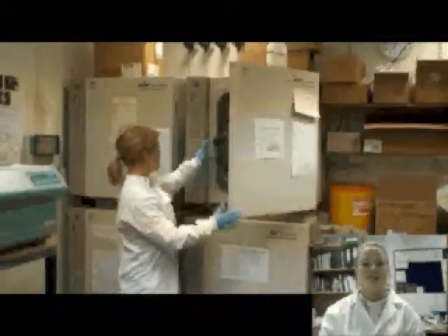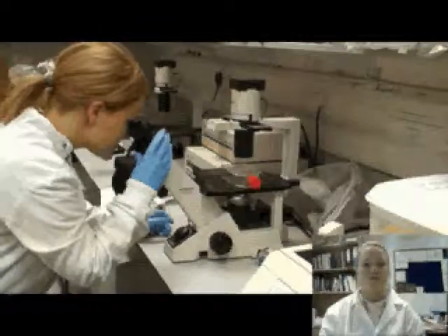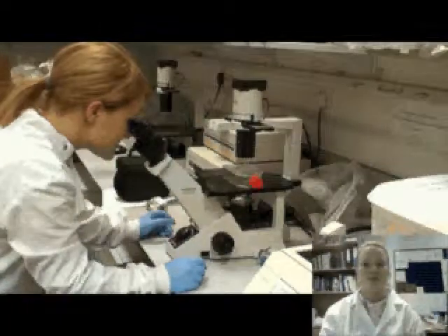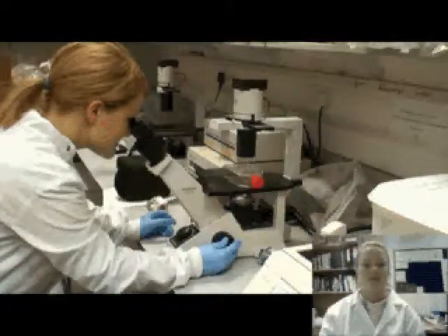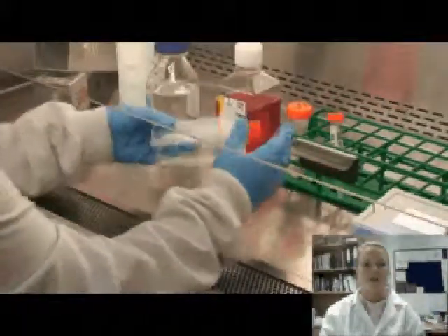I am now taking the cells out of the incubator and observing them underneath the microscope to make sure the cells are no longer adhered to the flask. I am now gently tapping the side of the flask 3 times to remove any cells that are still bound.